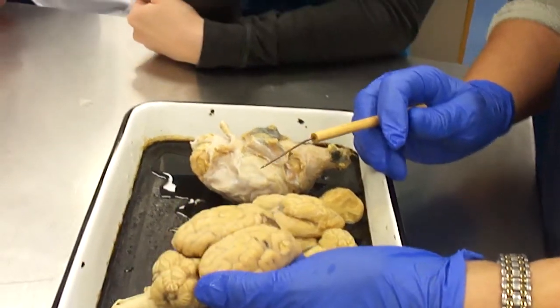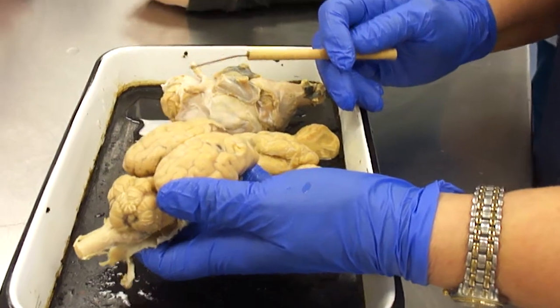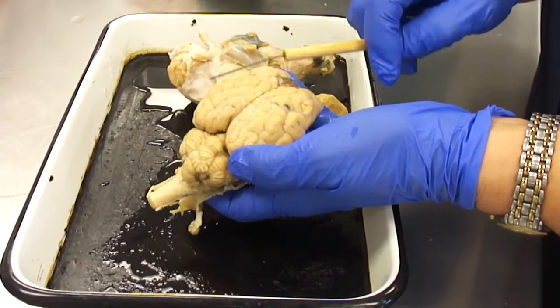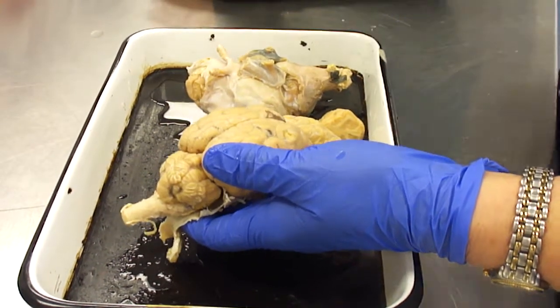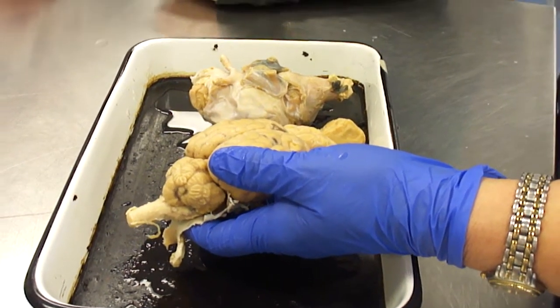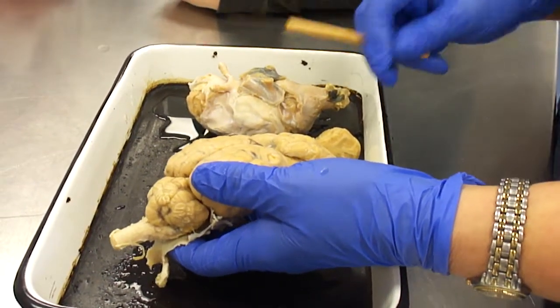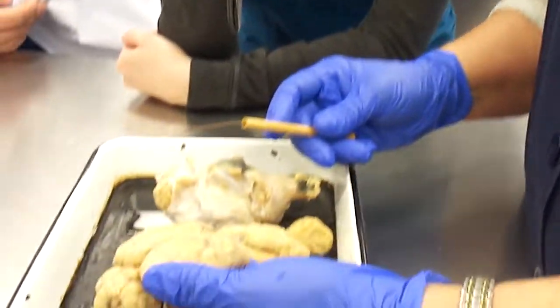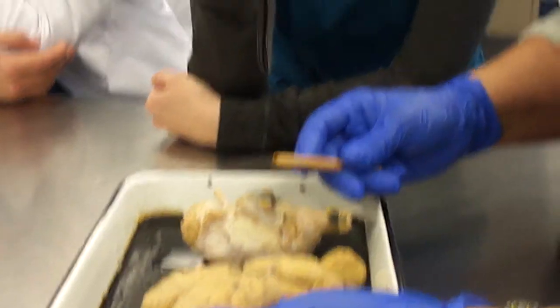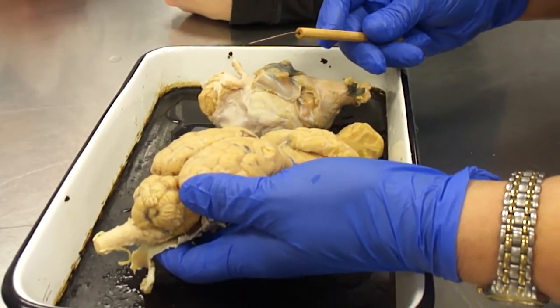So sheep aren't exactly known for their massive intelligence, and there's not a whole lot of gyri and sulci. If you look at the models of the human brains up in the cupboard there, there are many more gyri and sulci. Supposedly, we are more intelligent, okay, as a species. The nervous system is great for being able to deliver ultimate insults.